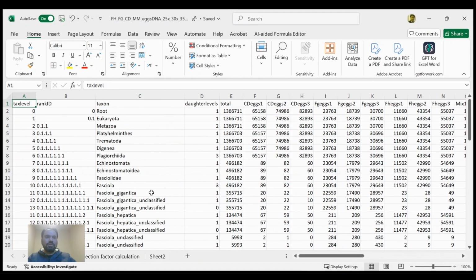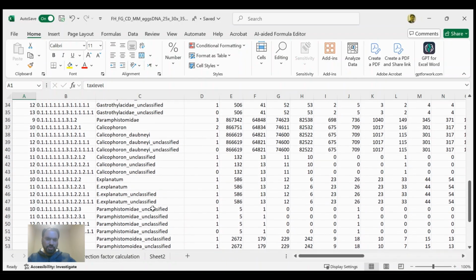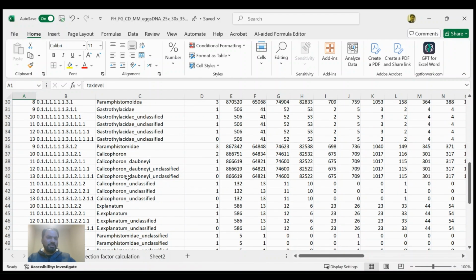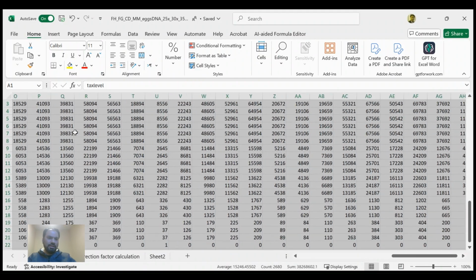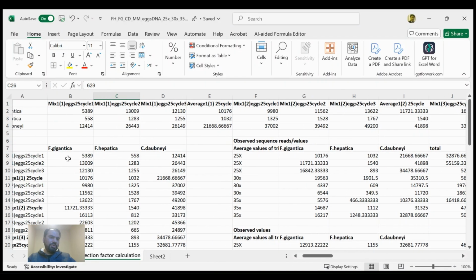So how can we calculate the biases which are produced during the deep amplicon sequencing or MiSeq run? Today's presentation purpose is to remove biases from these sequence reads. Here you can see the different taxonomical levels that are produced, and the different numbers of sequencing reads produced against them. For calculation of biases, we just need to select it all with Control A, and then copy and paste it on a new sheet.